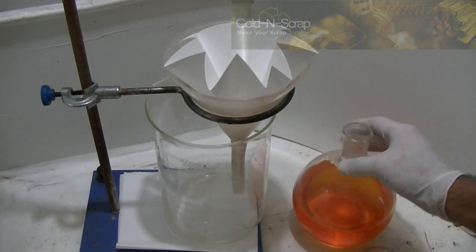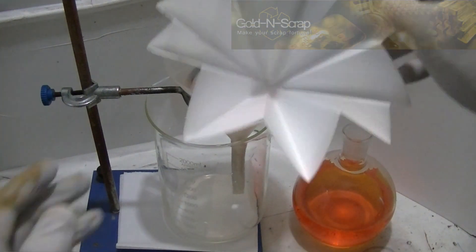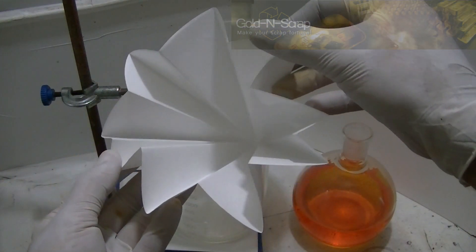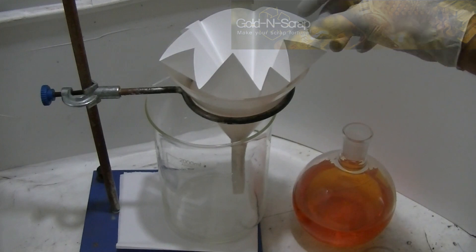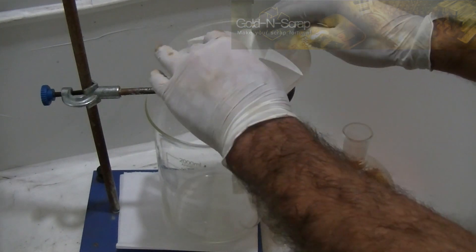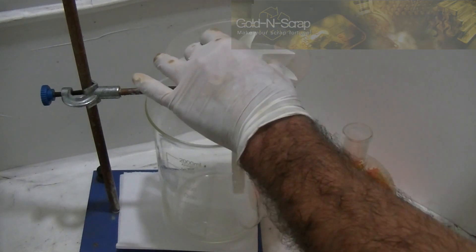It is highly recommended using a proper laboratory filter and not store bought coffee filters. I am using medium slow speed filters, which will strain any solid particle over 5 microns.